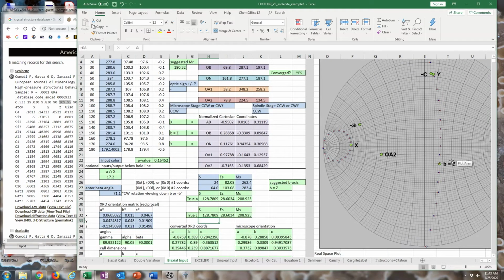Okay, so B is equal to Z. That's correct. That's good. A is right. And C, that's actually the C axis that I want in this case. If I use 109, it'd be out there. It just so happens, like I explained, that that axis has similar translational characteristics as the alternative one, even though they are different directions. But this is the correct setting to use.